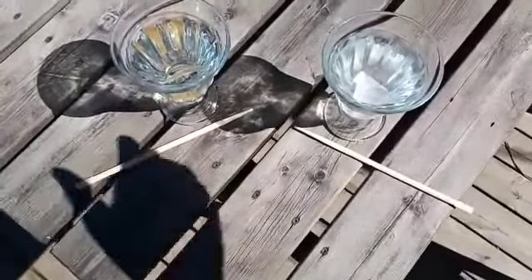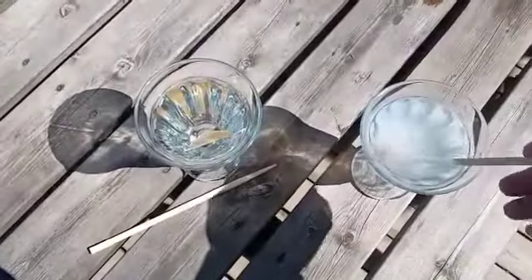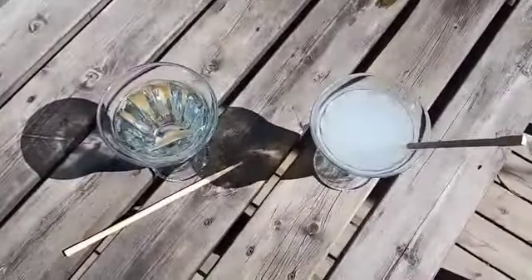If I stir a little bit now here, you can see directly the Dural product starts to dissolve.